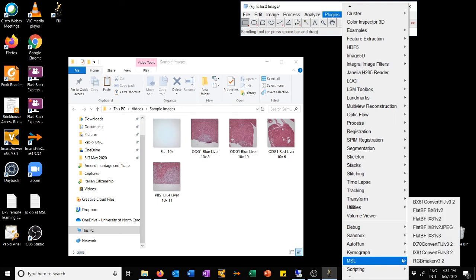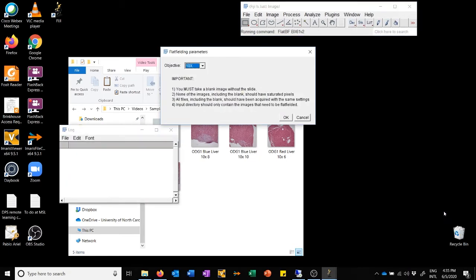If we go here, we'll find a plugin called Flat BF BX61. There's also a version for the IX81. You should just use whichever version corresponds to the microscope on which you acquired the images. So because these images were acquired on the BX61, that is the one that we're going to use. When I click on that, it asks me which objective we used. For these particular images, it was the 10x, but you can see here all the other options.